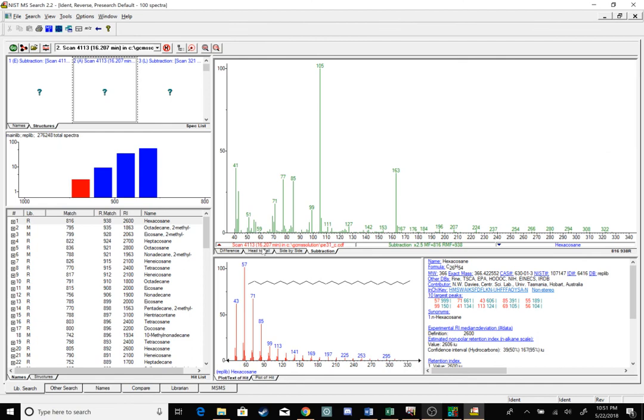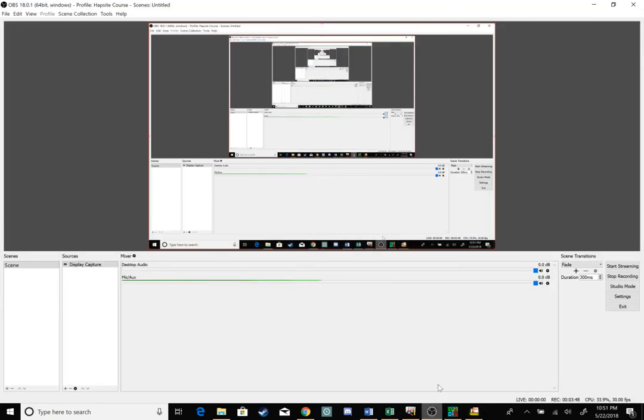It's a tough call for this chemical, but that's how you import things into AMDIS and then NIST and do your subtraction, or as I think I mentioned it in class, the search residual function. I hope this helps. Thank you.